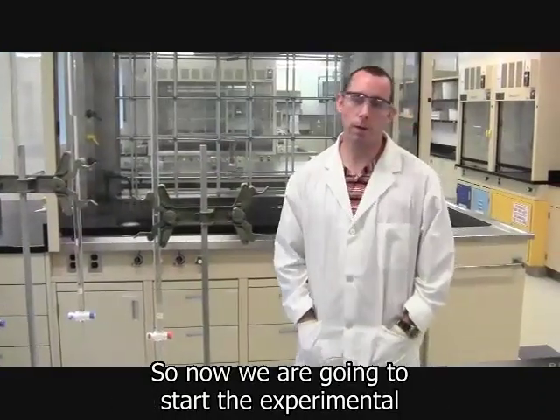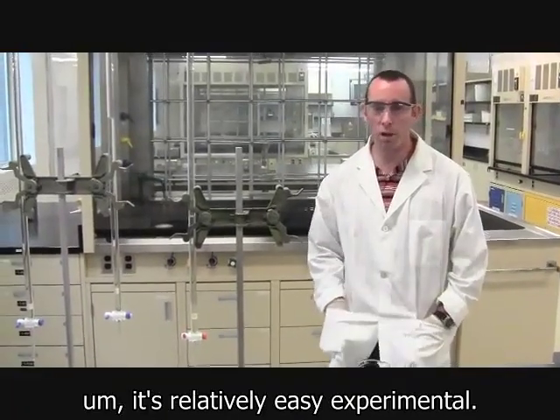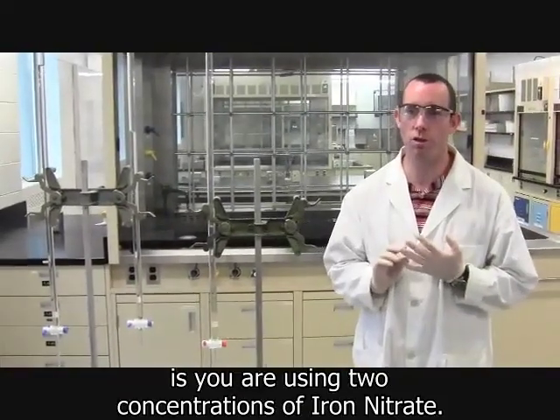So now we're going to start the experimental for the iron thiocyanate equilibrium experiment. It's a relatively easy experimental. One of the big things you need to be careful with when you're getting going is you're using two concentrations of iron nitrate.